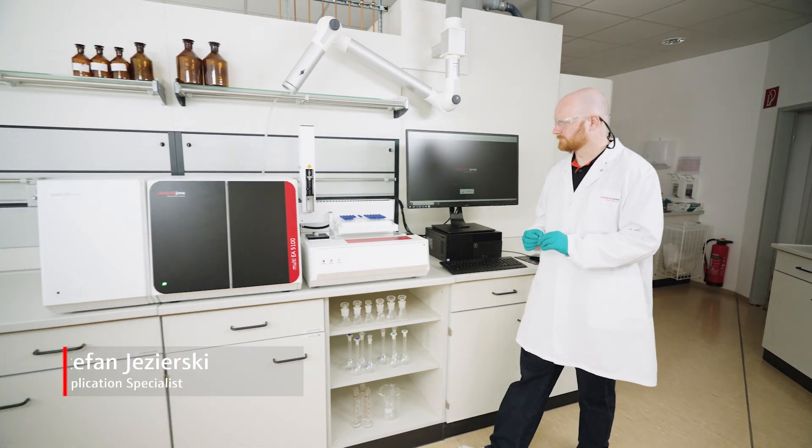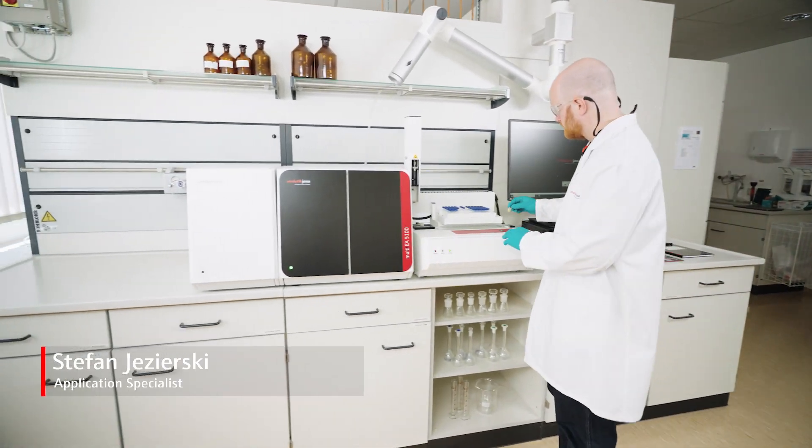My name is Angela and together with my colleague Stefan, I would like to talk about oil analysis by combustion elemental analysis technique. Today we want to discuss sample preparation, method setting, system configuration, and data evaluation. This can be done in feedstock materials, process intermediates, auxiliaries, or ultra-pure final products.